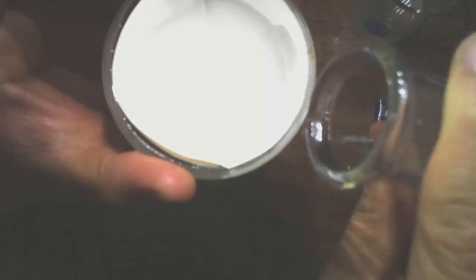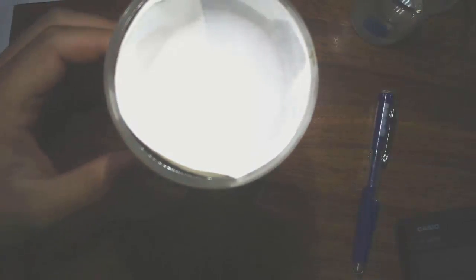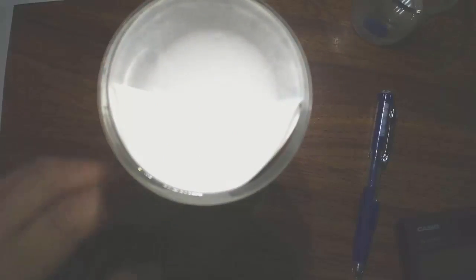And we're going to come back to this later in the reaction. And notice how, if we look on the bottom right here, it starts dripping right there. That's because the water has gone through the filter paper, leaving behind the solid precipitate, which is chalk. And other substances that are smaller than chalk will of course also filter down as well. And you can see that right there. Notice how the water is a lot clearer. See that? So we're going to get back to that later.